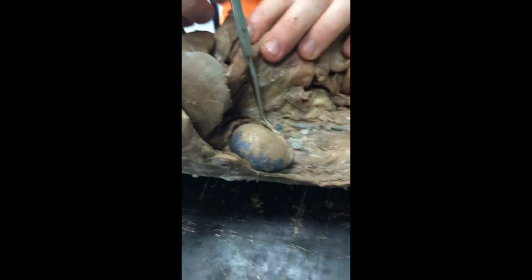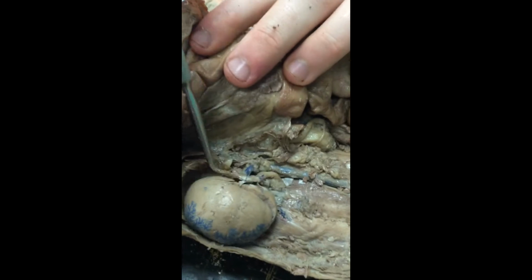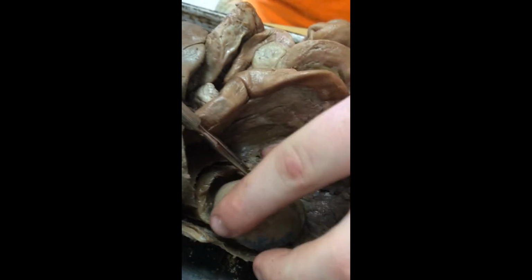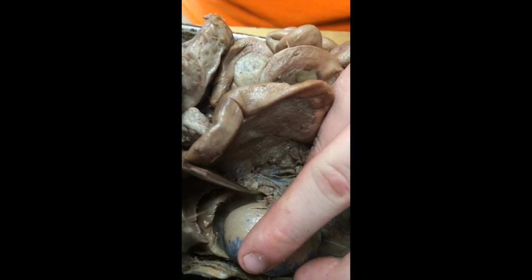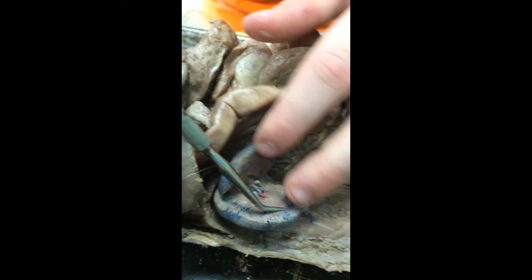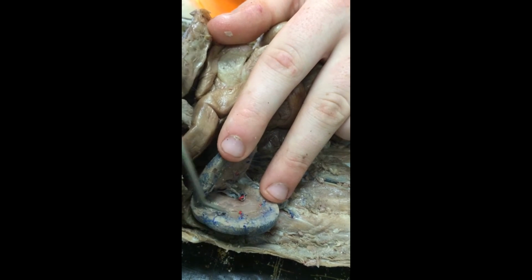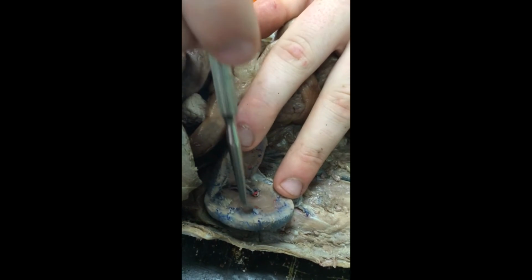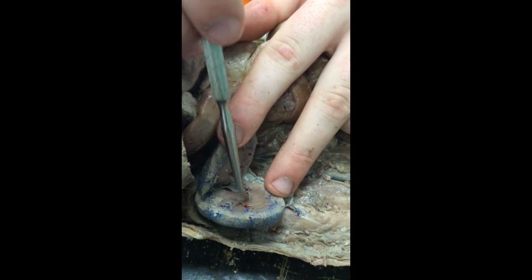First, we have the blood vessels of the kidneys, which are the renal vein, which is right here. And then right next to it, under a little bit of fat, I'll make it clear, is the renal artery, which is right here under a little bit of fat. And then inside the kidneys, we have the renal cortex, which is the lighter outermost part of the kidney. And then we have the renal medulla, which is the darker inner center part of the kidney.